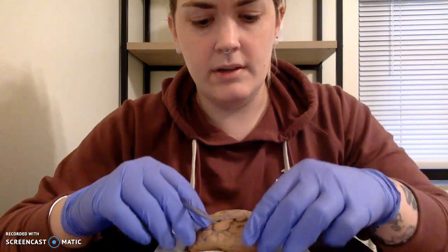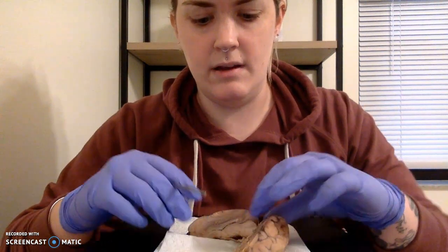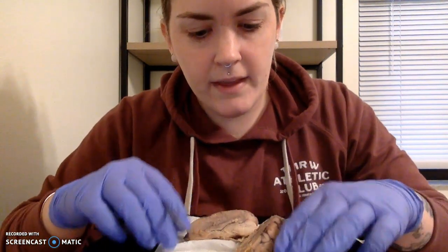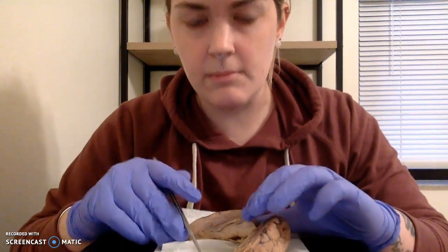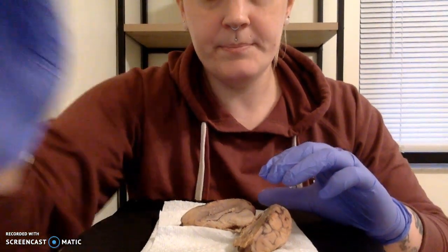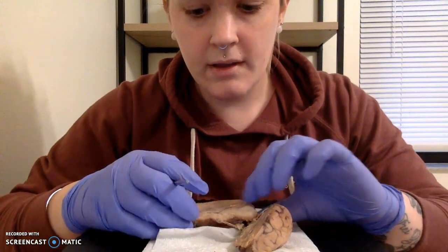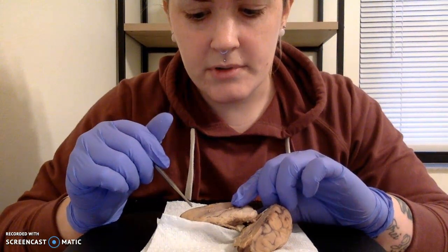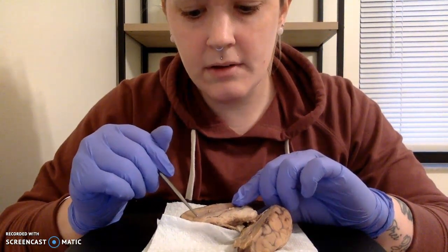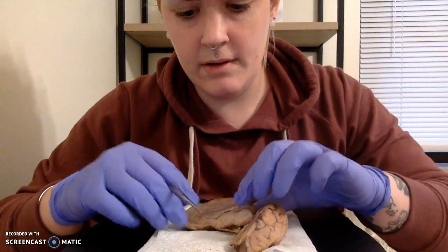So then if we're looking at the dissection from the inside, we're going to look at some features on the inside. And again, I think I did okay. I think I might have accidentally cut some features, but I think we can still kind of see them. So here, I'm going to tilt you in just a little bit. Here, we're going to look at our corpus callosum, which is going to sit right in here. I think we got a good view of that. My paper towel might be in the way.